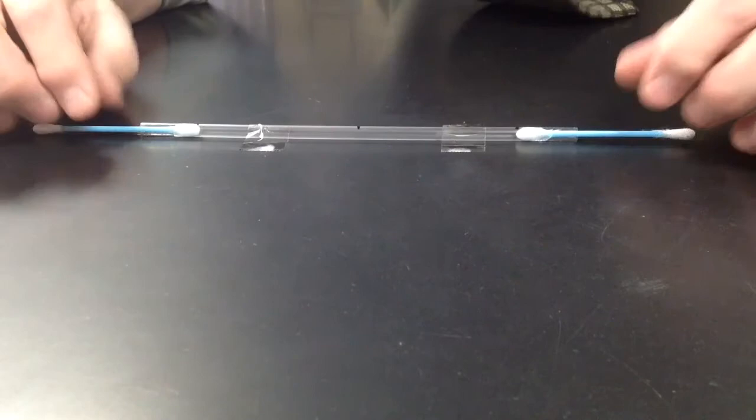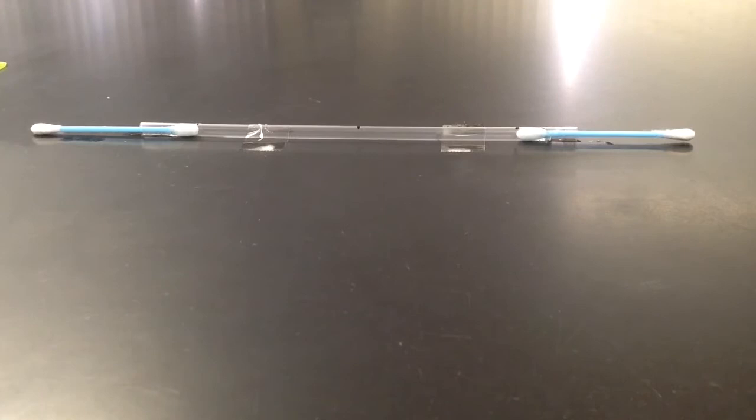Students obtain ammonia and hydrochloric acid solutions on the end of q-tips, place them into the straw which is taped to their table to anchor it down.